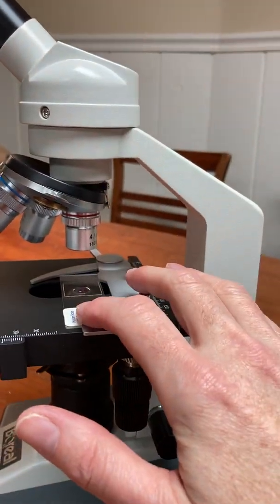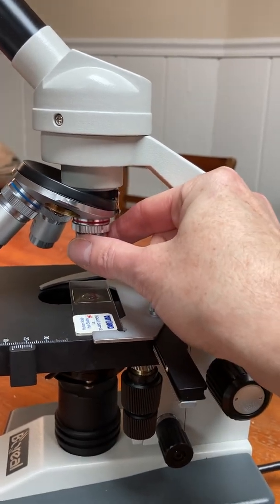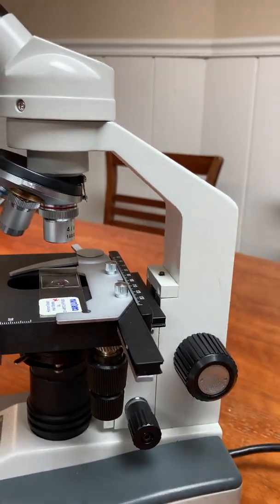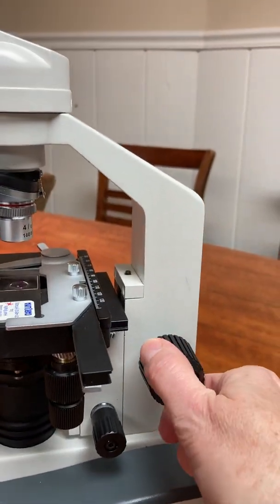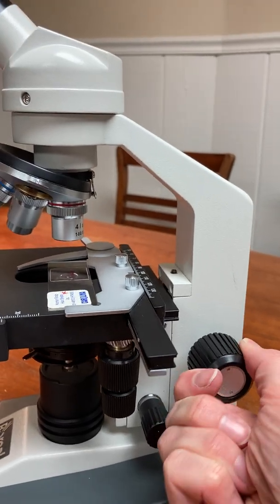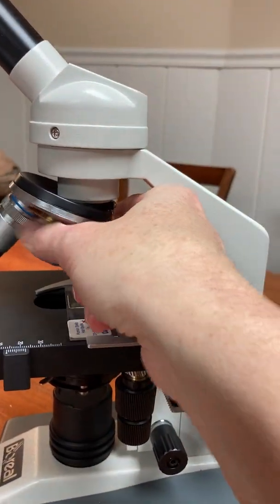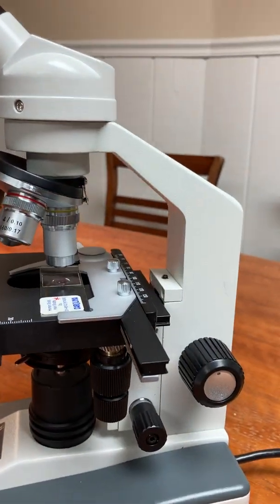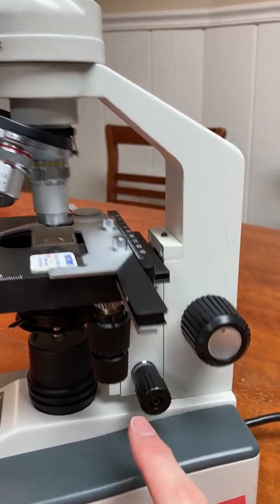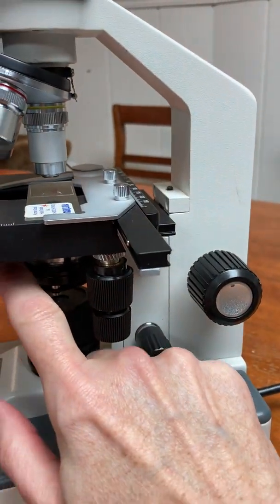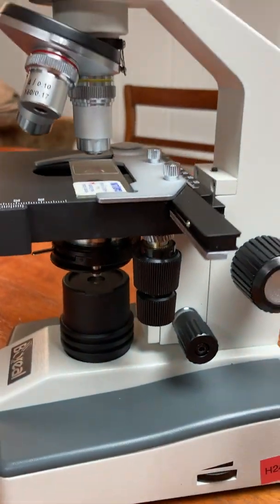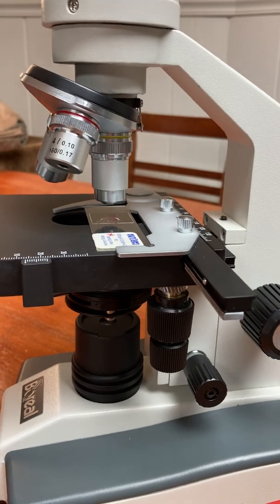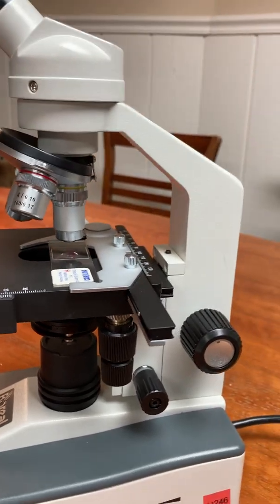So you would put the microscope slide in, move the scanning power into position, and then look through the ocular, adjust the light with the iris diaphragm lever, and then use this coarse adjustment knob to focus. When it is focused, you move the objective lens to the next power, and then you use the fine adjustment knob to focus. You may also need to add more light with the iris diaphragm lever down here. And then you'd move to the high power and you keep doing that. Okay? That's it.